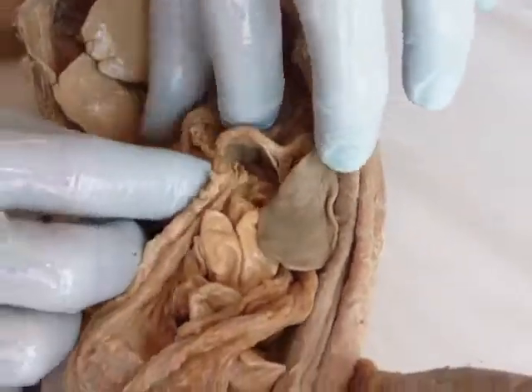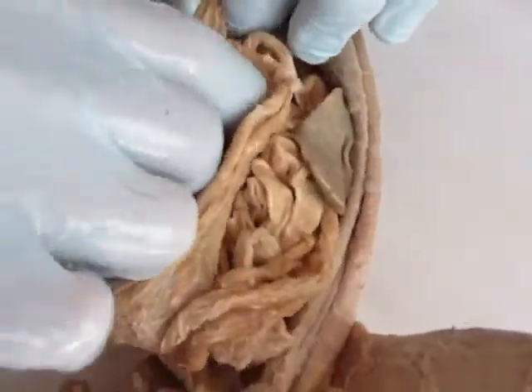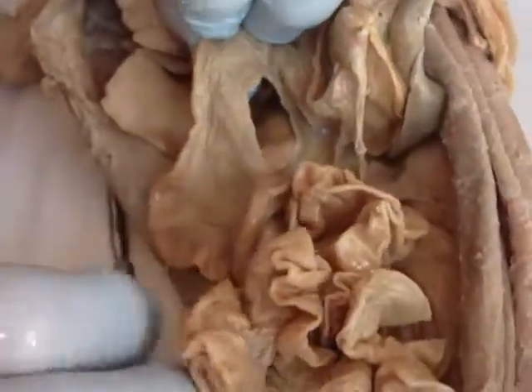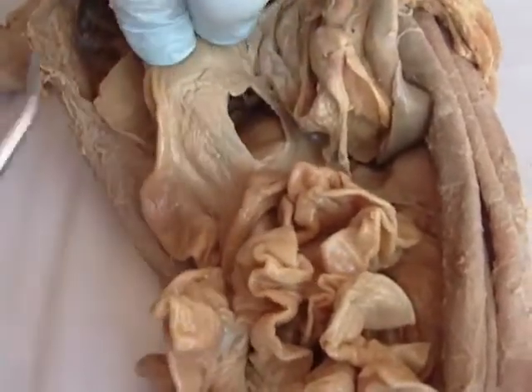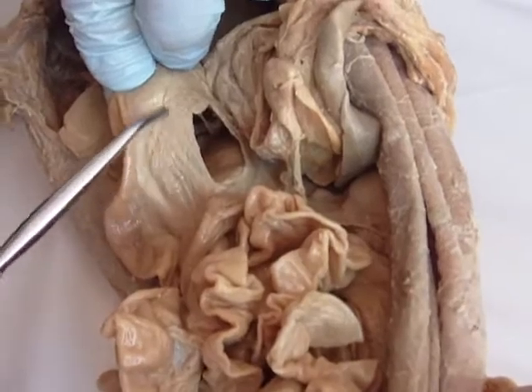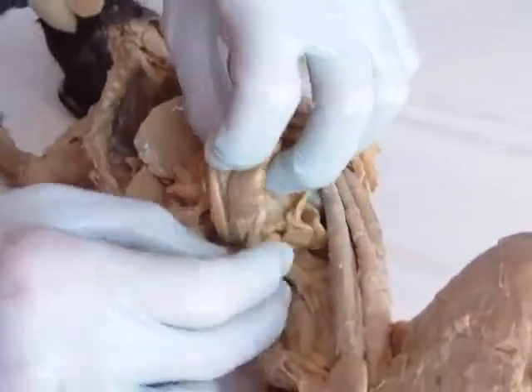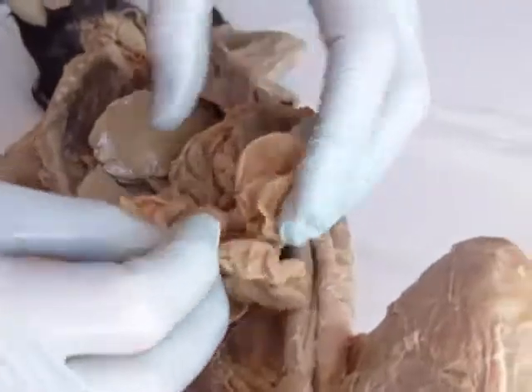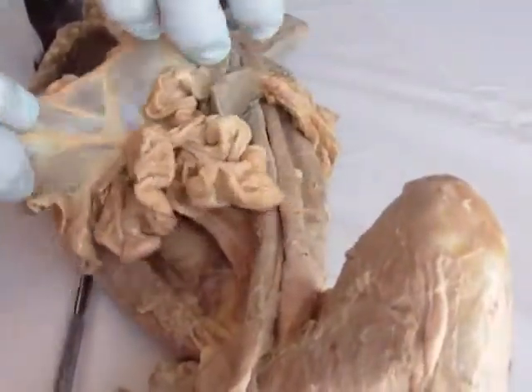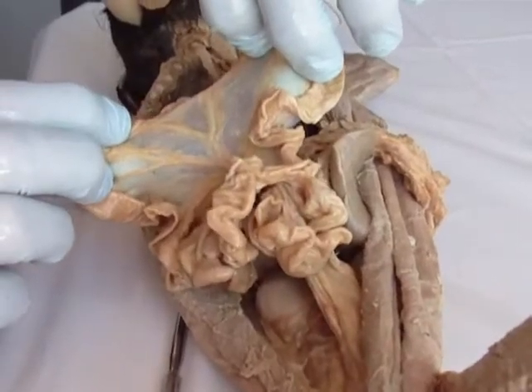Your stomach comes down and empties into this tube here called the duodenum. Right medial to the duodenum, you can see a spongy-looking tissue in there — that's your pancreas. The duodenum comes down into all this, which is your jejunum, and you pull your jejunum apart — it's held together by mesentery.